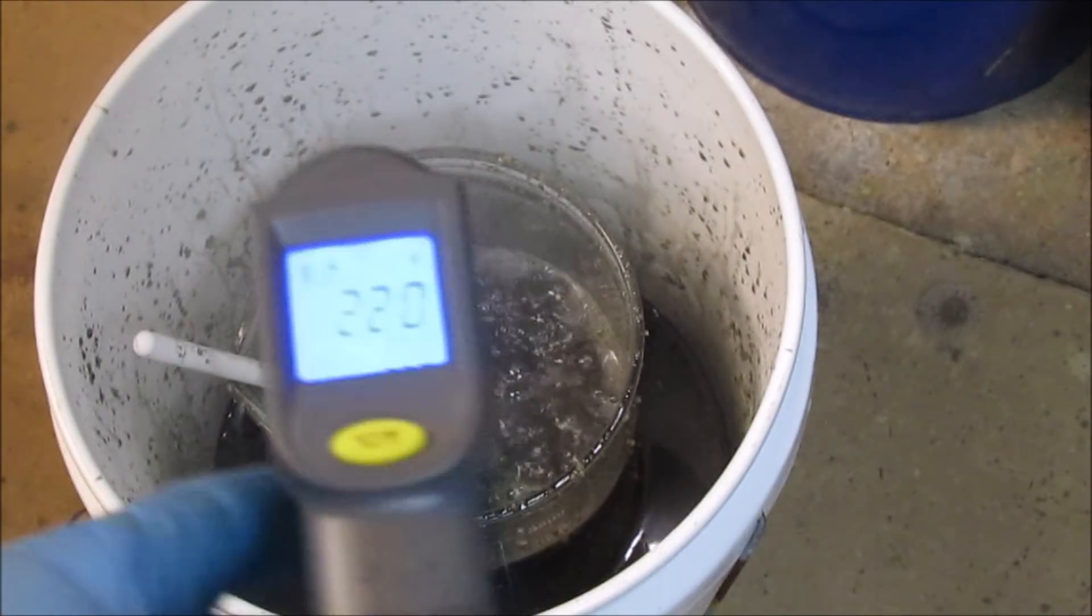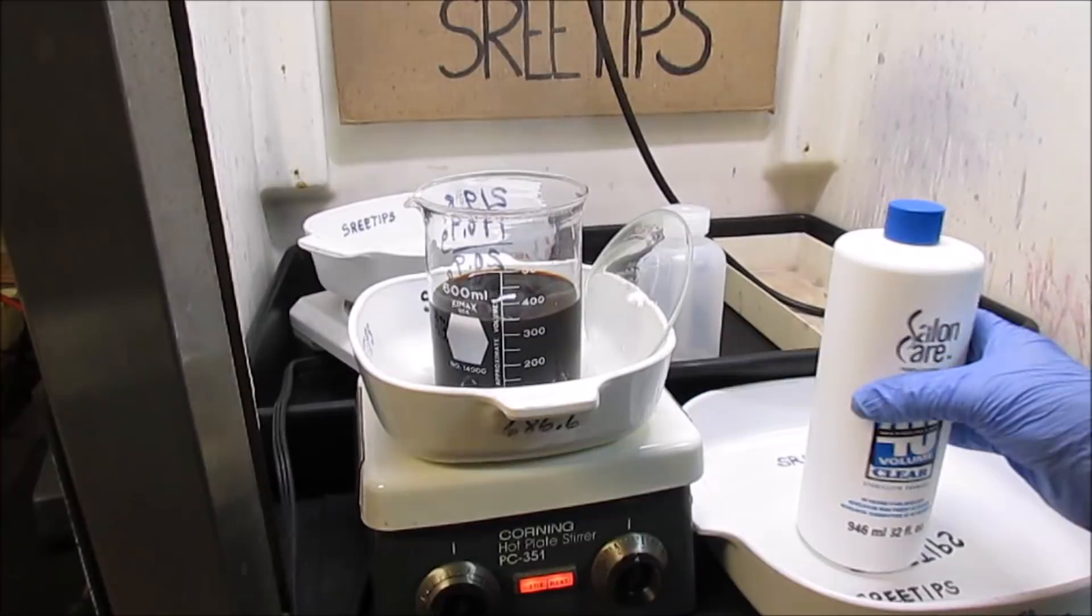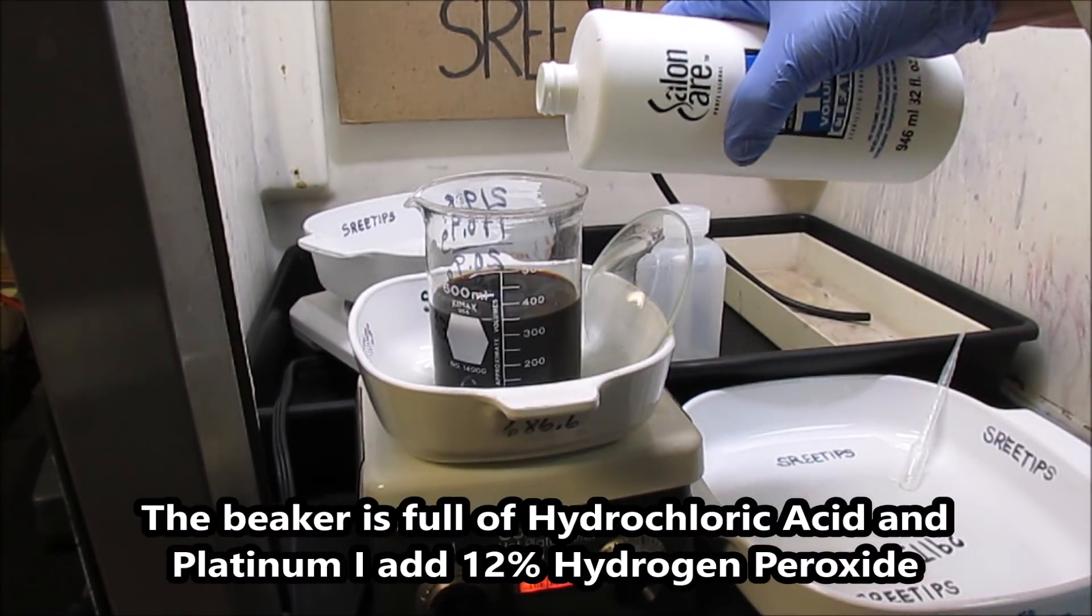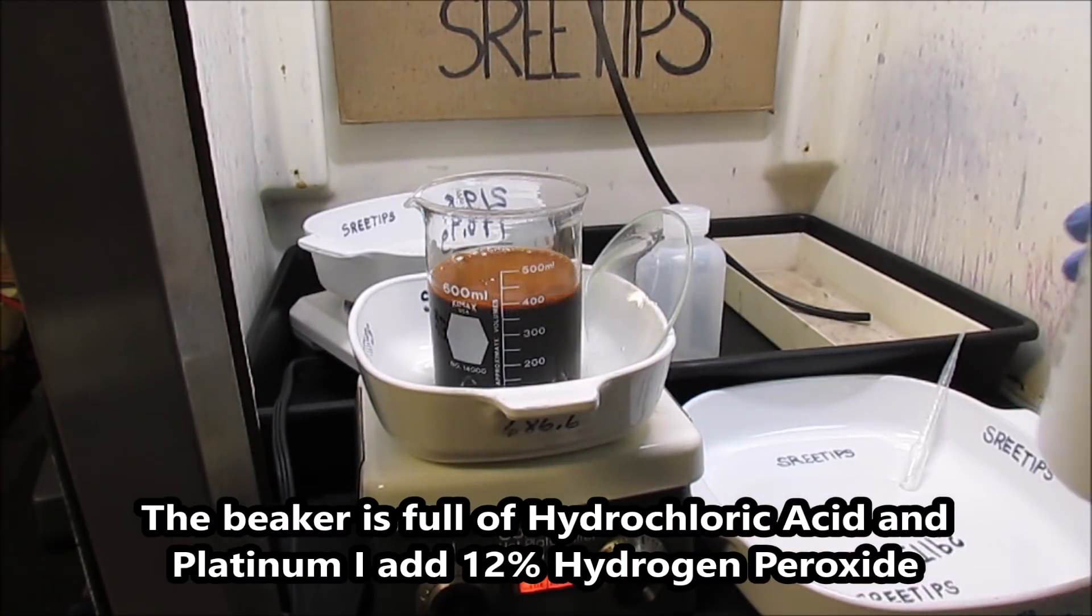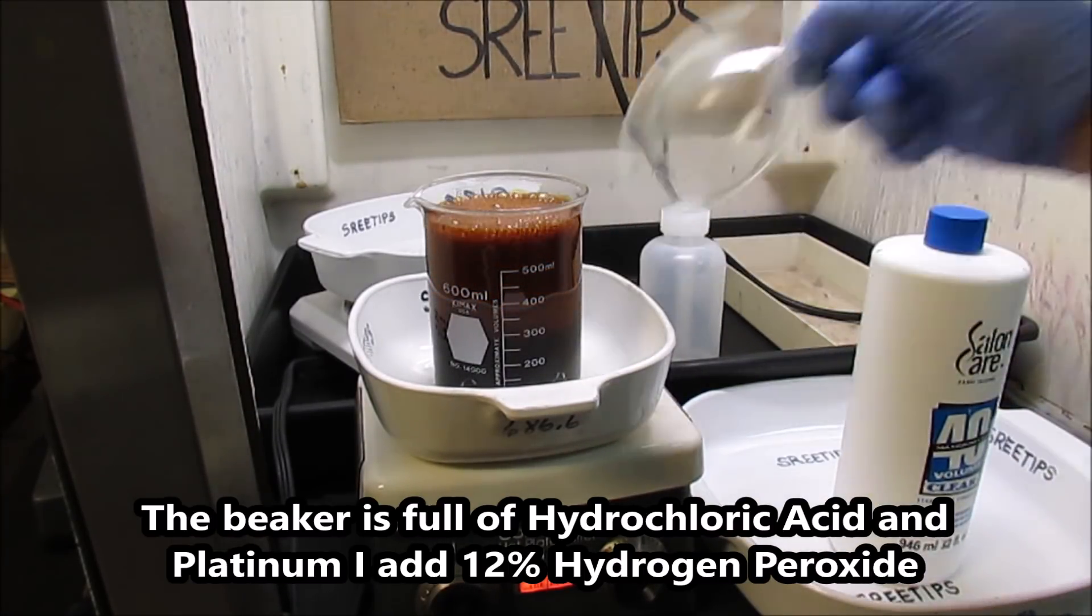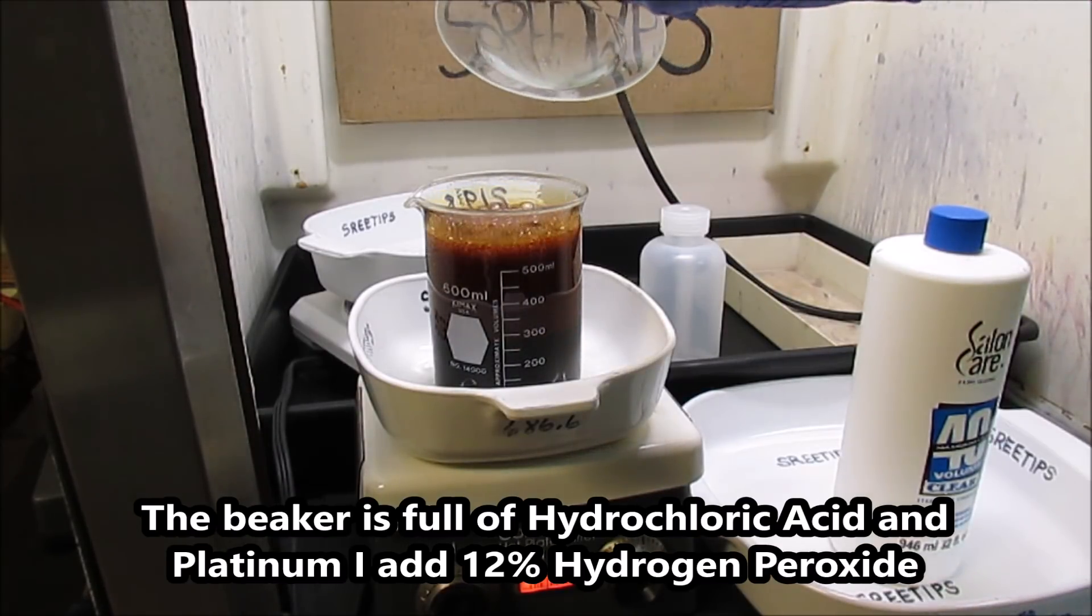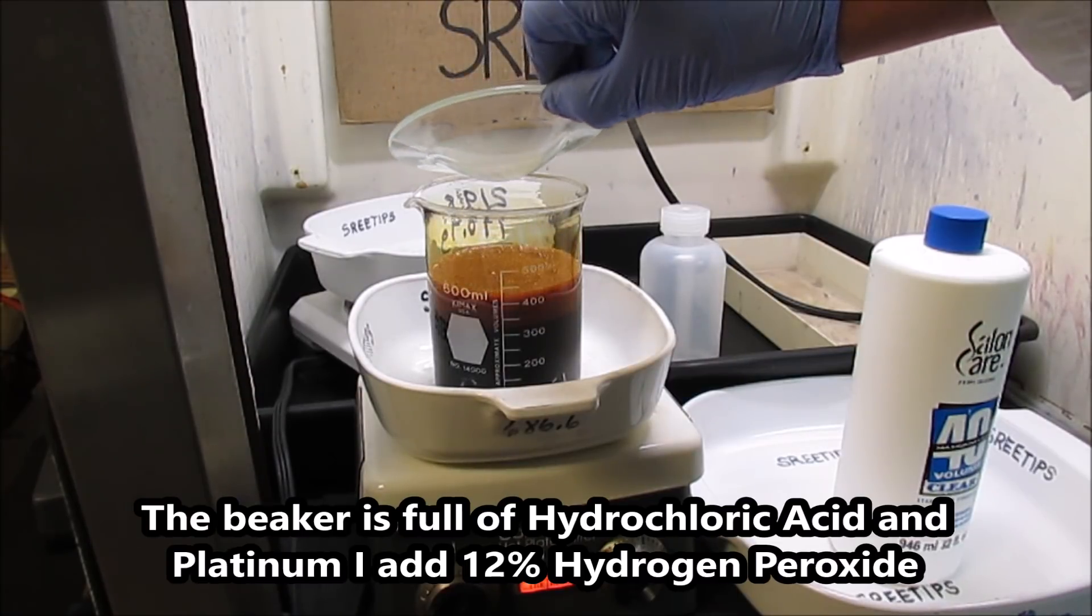220 on the temperature. I've got lucky there, got to start at it in smaller increments.